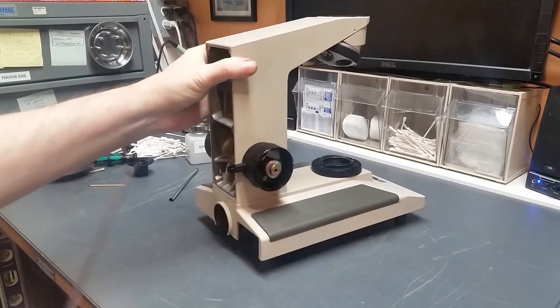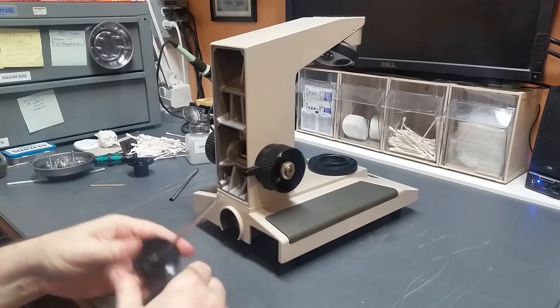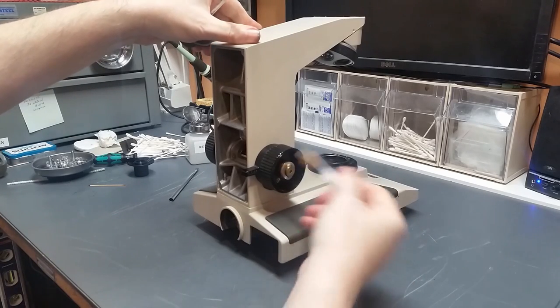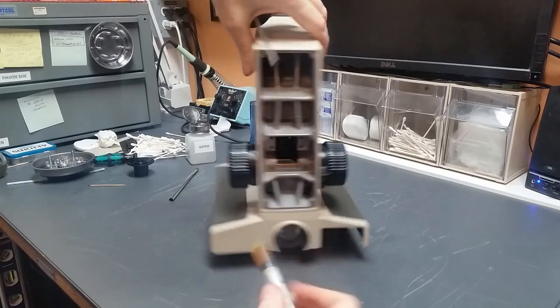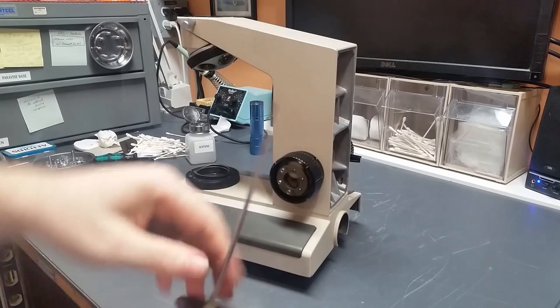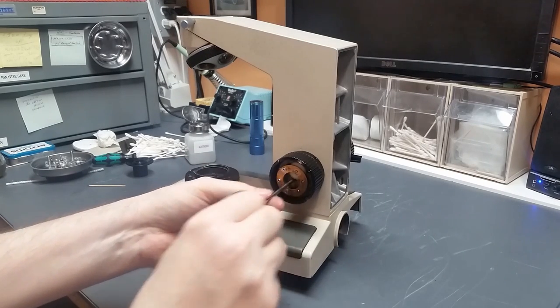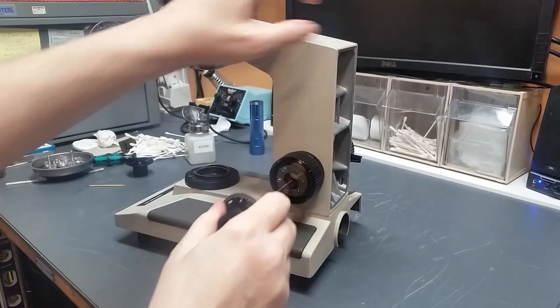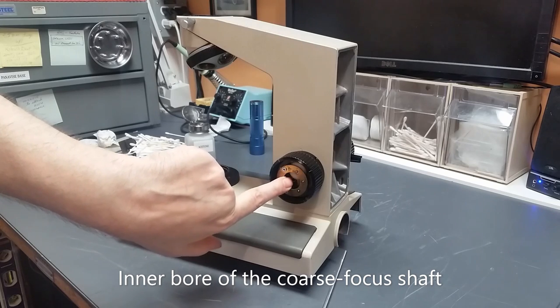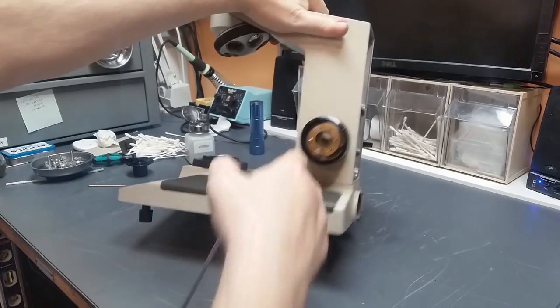Okay, so now it's time to put the fine focus shaft in. Time to put this baby in. First thing I'm going to do is squirt a little bit of grease in this hole here and a little bit in this hole here. Then I'm going to use the shaft to push the grease in, distribute the grease through that inner bore in this brass piece here that you can see in the center.